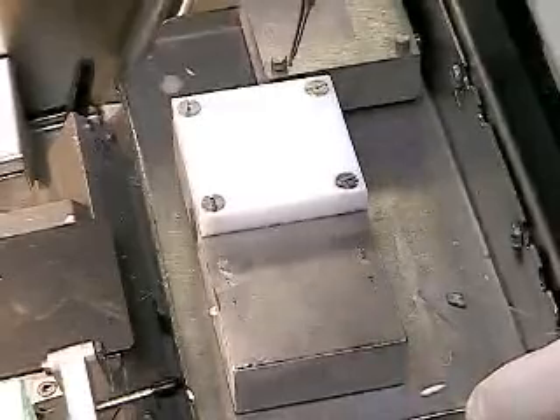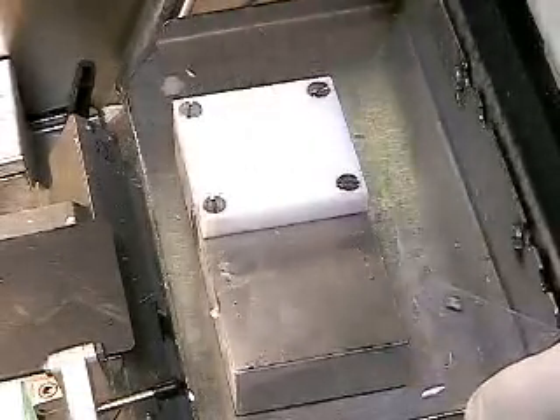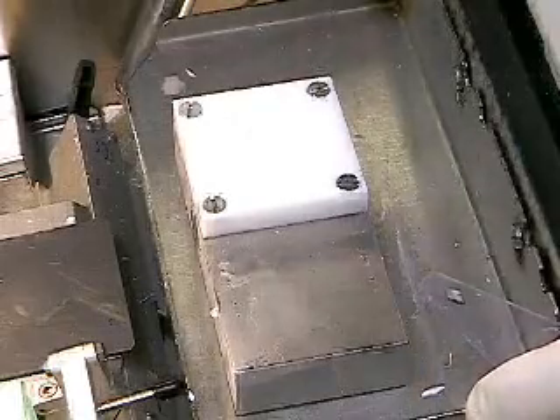This simple apparatus we call the cutting board freezing griddle. This would be the freezing griddle here, and this is the elevated freezing block. What this allows us to do is essentially freeze this minute specimen into a much larger block of embedding medium.